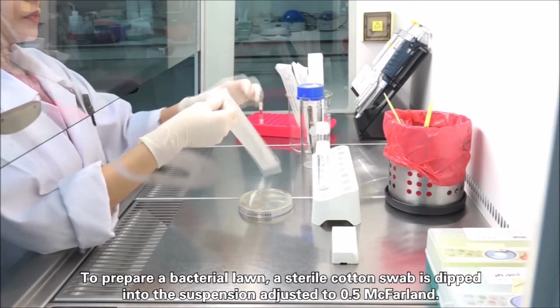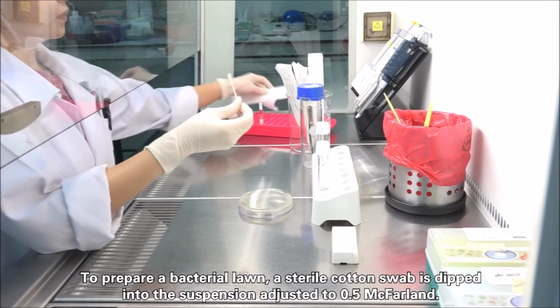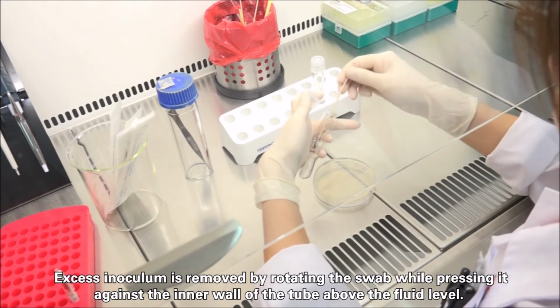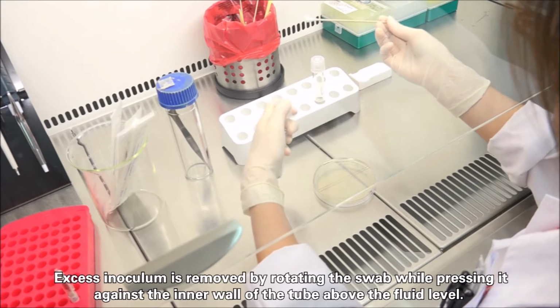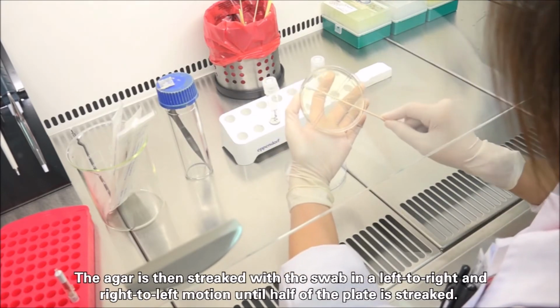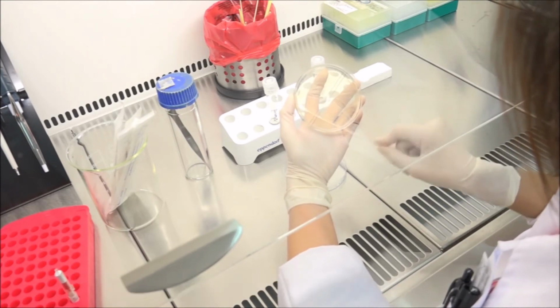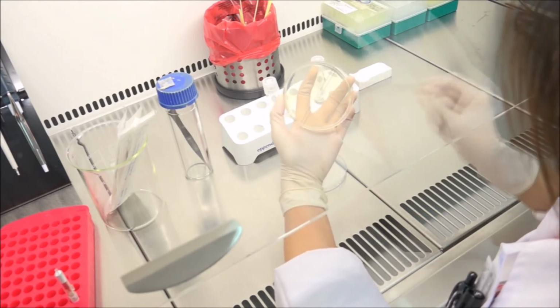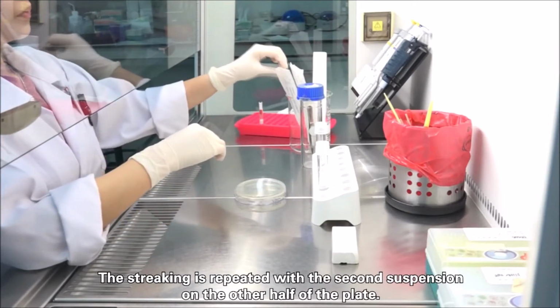To prepare a bacterial lawn, a sterile cotton swab is dipped into the suspension adjusted to 0.5 McFarland. Excess inoculum is removed by rotating the swab while pressing it against the inner wall of the tube above the fluid level. The agar is then streaked with the swab in a left to right and right to left motion until half of the plate is streaked. The streaking is repeated with the second suspension on the other half of the plate.